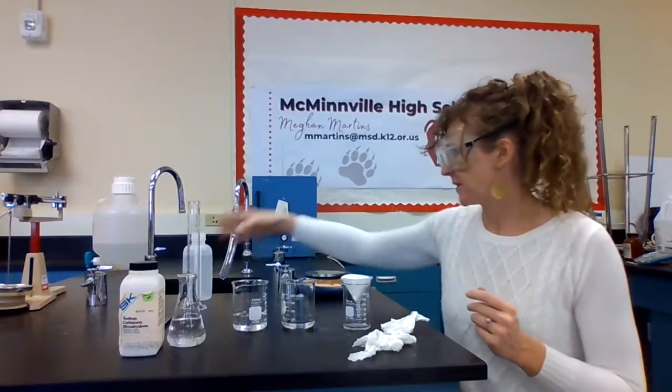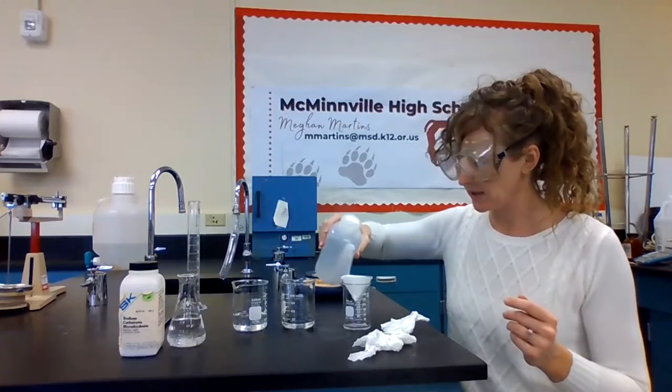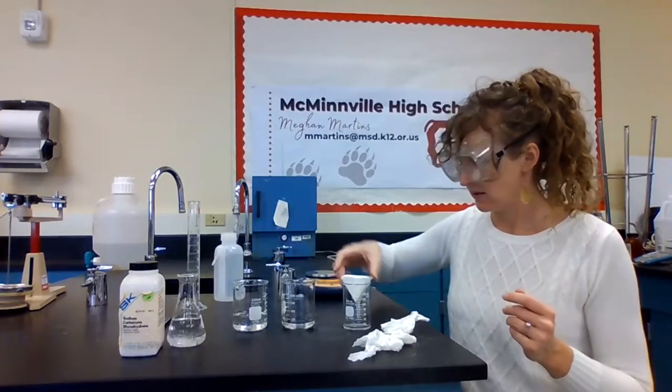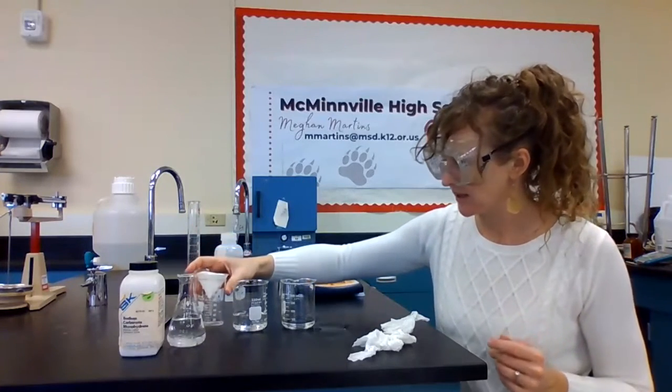Get my filter paper set up, and we'll get that wet. Start that draining process.